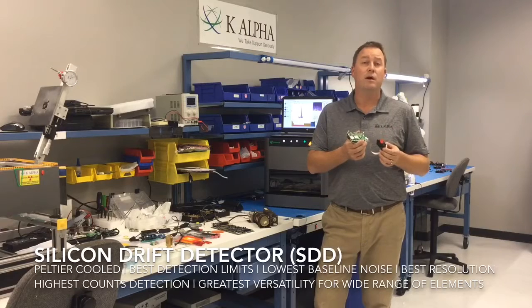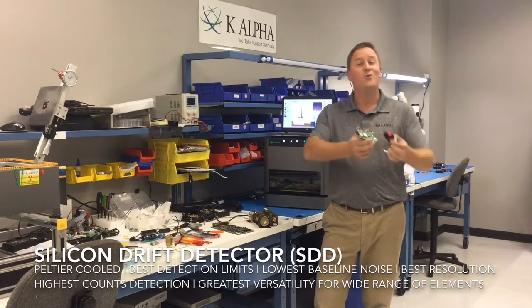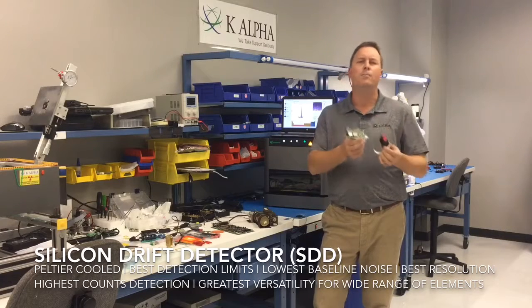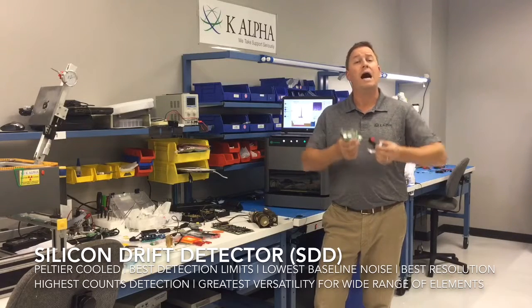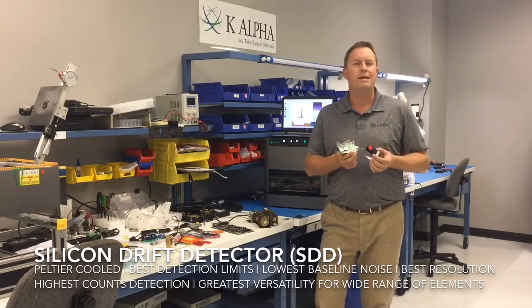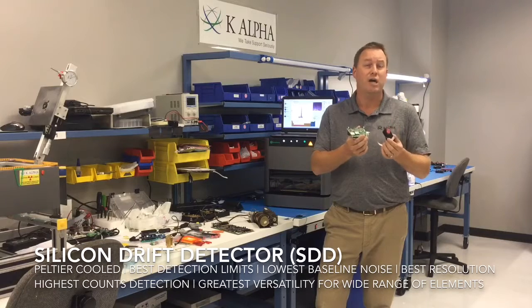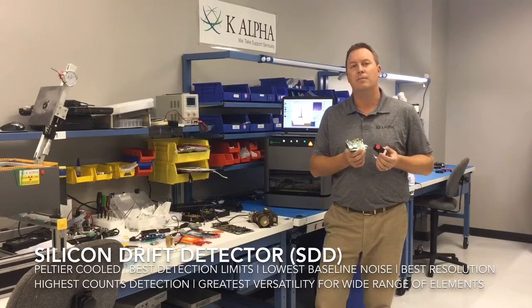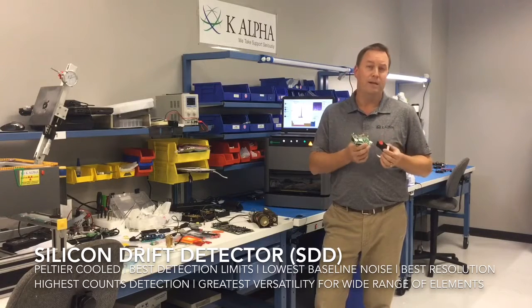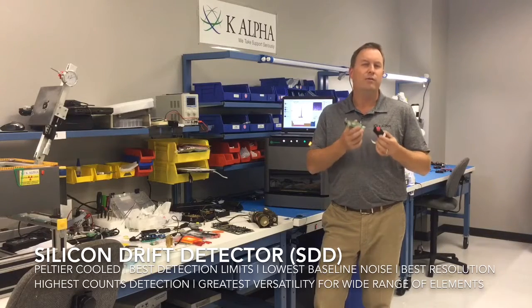We also have a silicon drift, or SDD, detector. Basically that's a PIN detector with just a little bit more capability. You get a little bit better resolution and a higher count rate throughput capability. It's really only used in specialized applications. The PIN detector does such a great job, but the SDD does add some things on top of it if you're using a bigger spot size or if you really need that extra resolution.